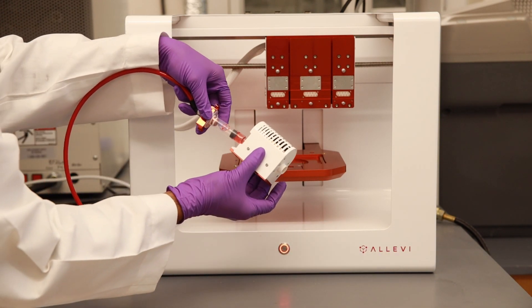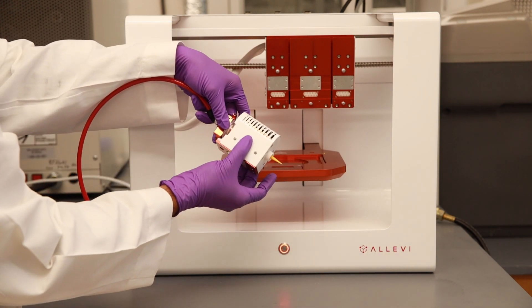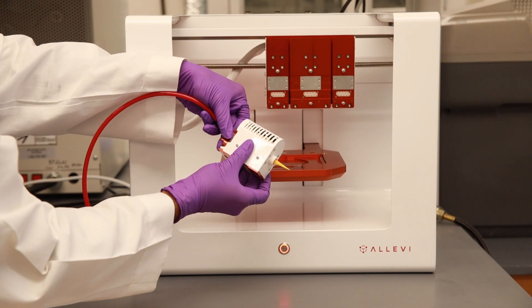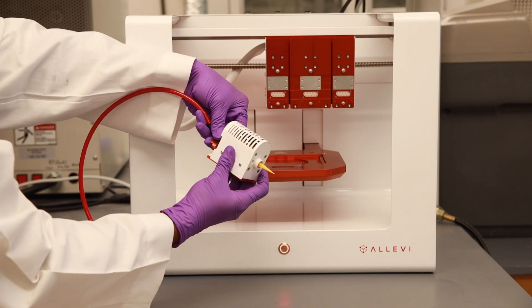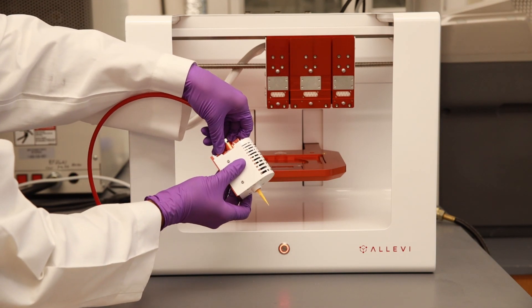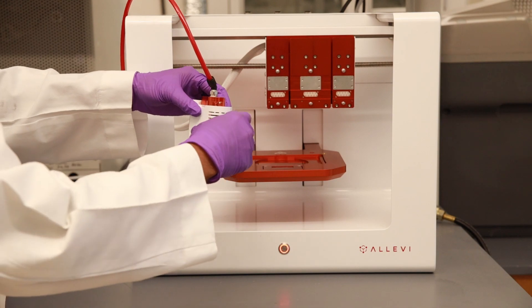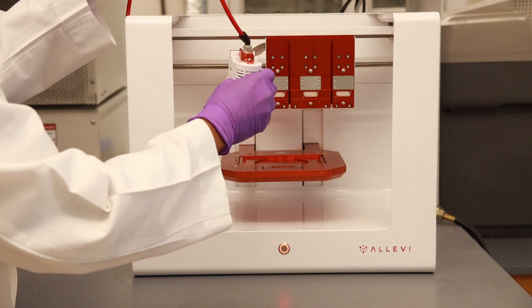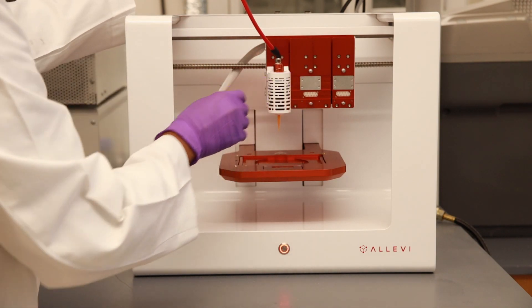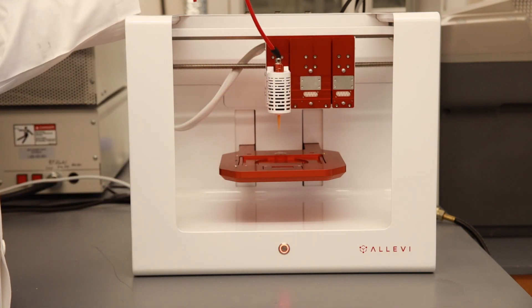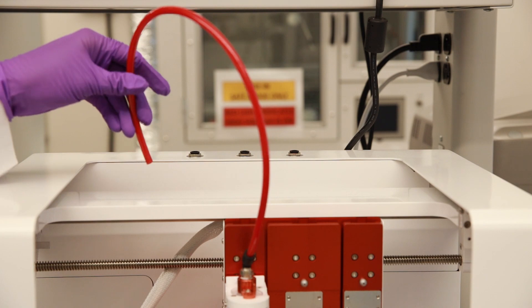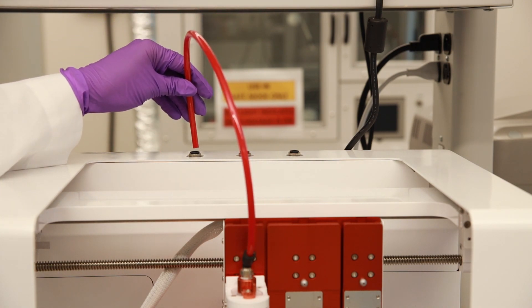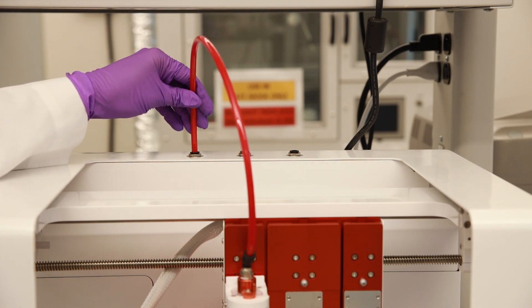Transfer this assembly into the extruder and turn the air compressor line adapter to lock in place. Mount the extruder onto the printer. The other end of the air compressor line adapter goes into the printer.